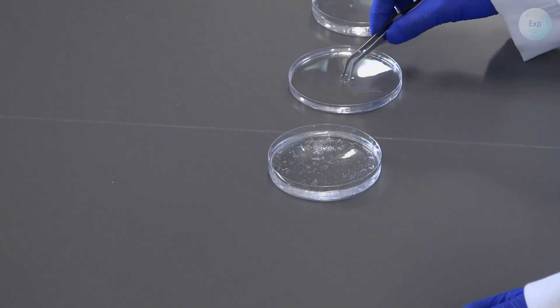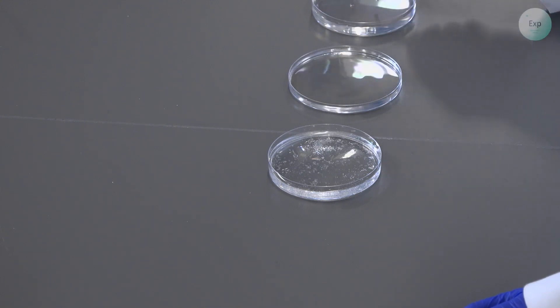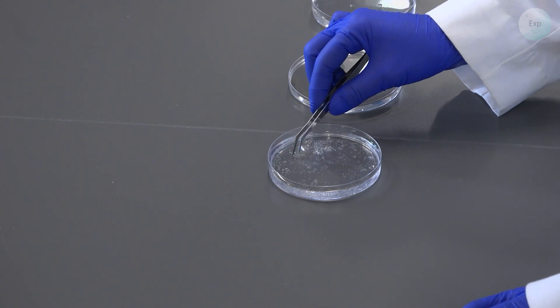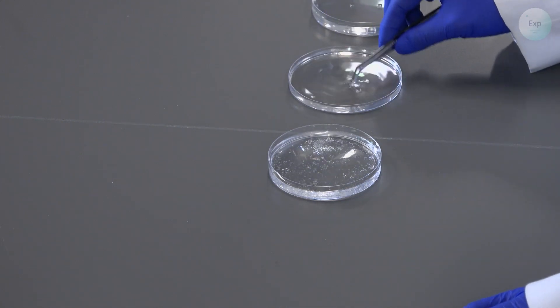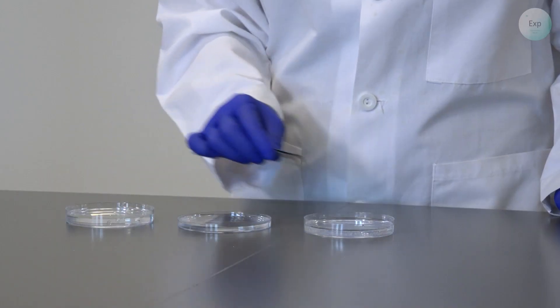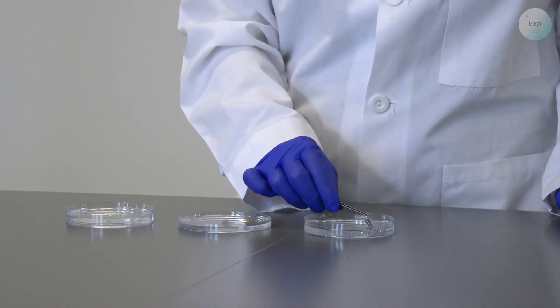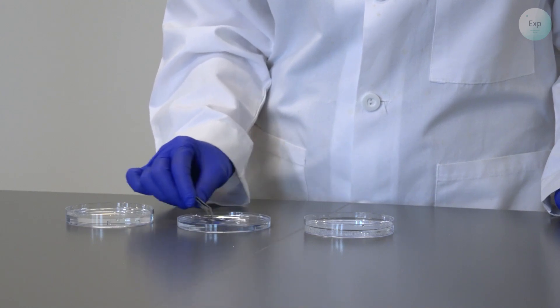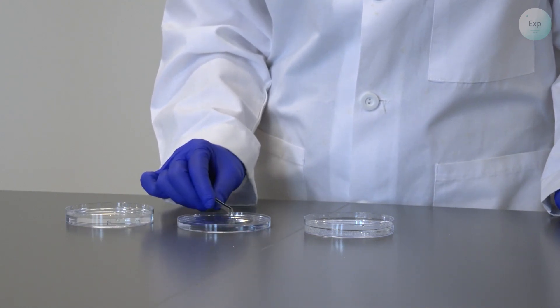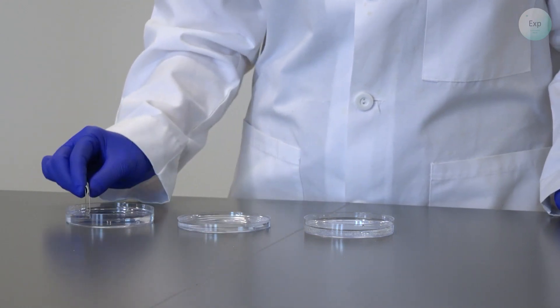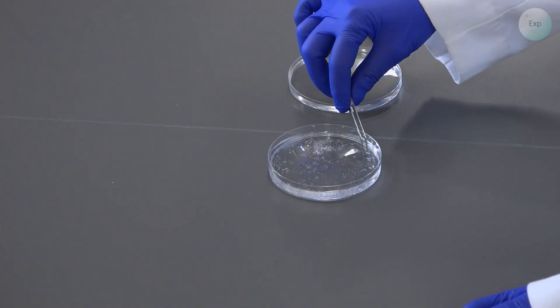I will take my second crystal, place it into the deionized water, and then transfer it into the growth solution, and I will repeat it three more times. We want to place these crystals quite far from each other so that there is no accidental mingling of crystals or the opportunity for the crystals to grow on top of each other.